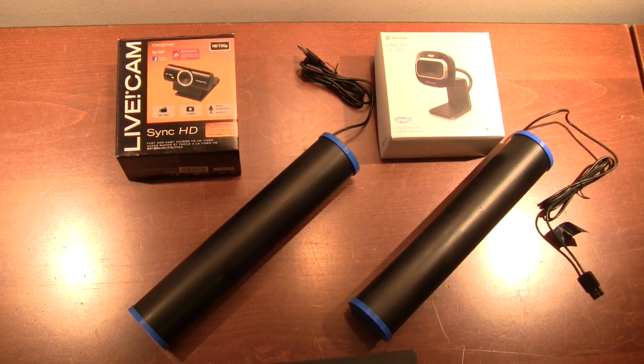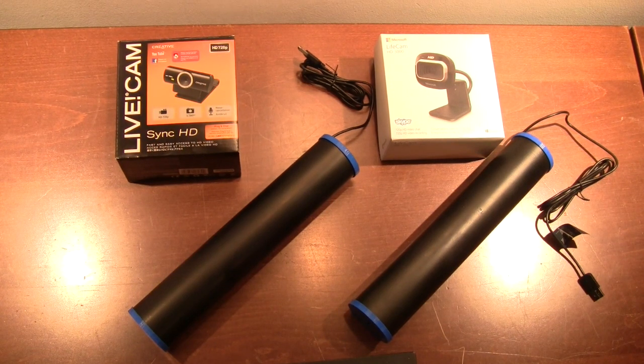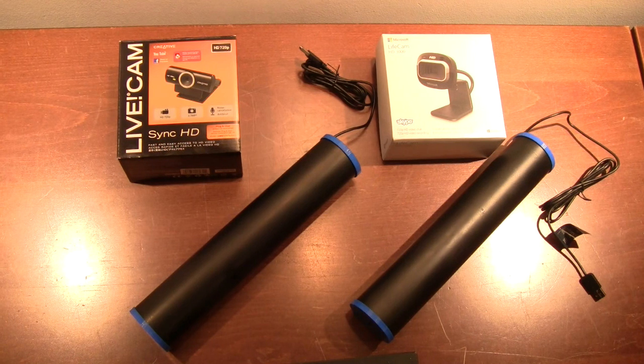I'd like to describe today two versions of a light spectrometer that I've been developing here. The idea was to create a webcam spectrometer that can run the excellent Theremino software interface that is available on the web. The design I've been using is straightforward.